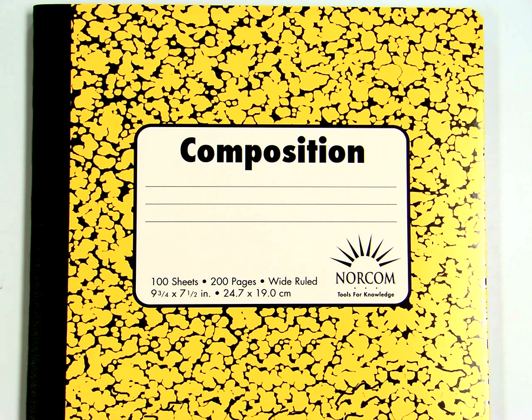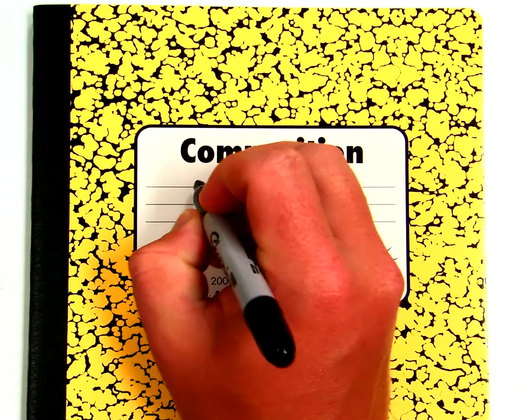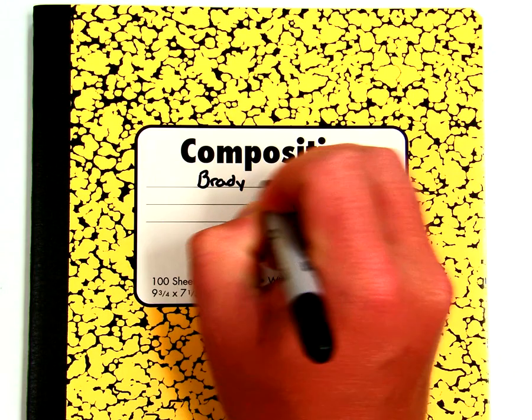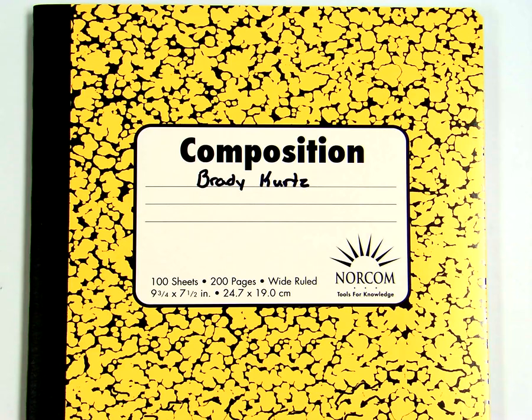So you're ready to start using your lab notebook. One of the things that we'll need to learn is how we go about using a lab notebook and what it's meant to do. First thing you want to do is get your name on it. So on the front cover somewhere, please just write your name, nice permanent marker, legibly, preferably, so that everyone knows that it is your awesome lab notebook.